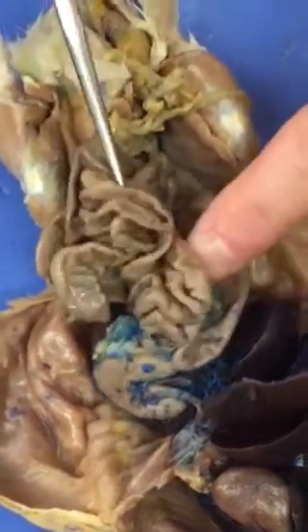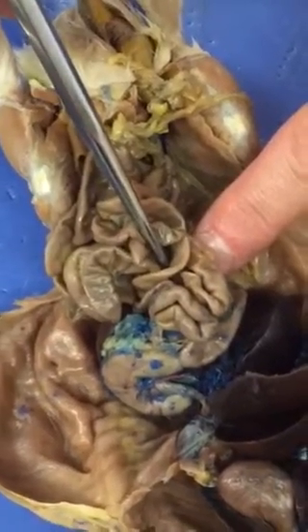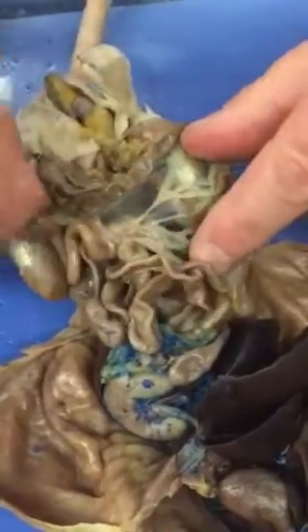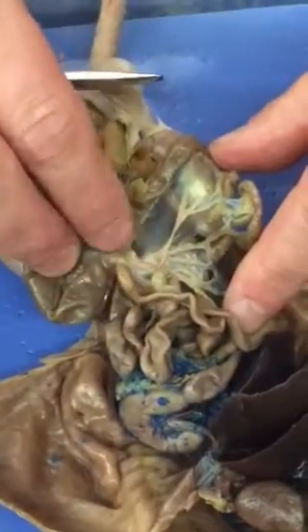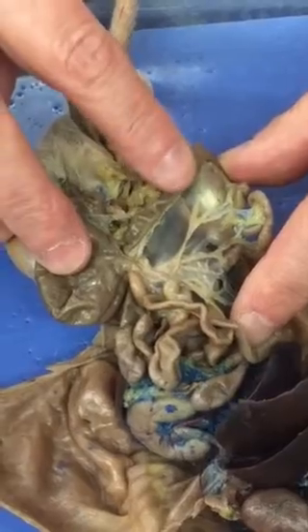To show you the jejunum, I would just have the pin in the middle of the coils. But in order to see the ileum, you need to first locate the cecum. And the cecum and the surrounding structures will be spread out like this so that you have a right angle right here. This part of the right angle is the ileum.